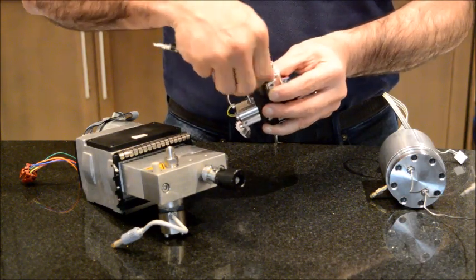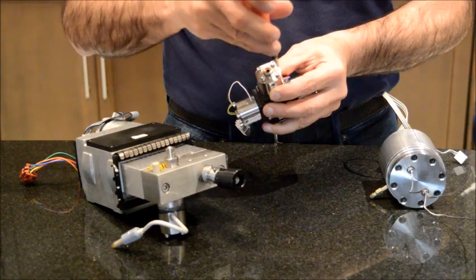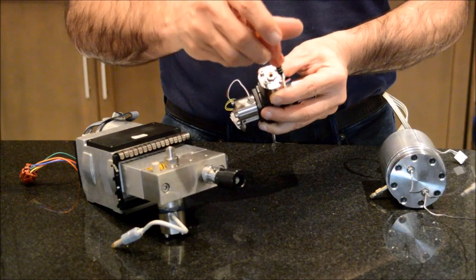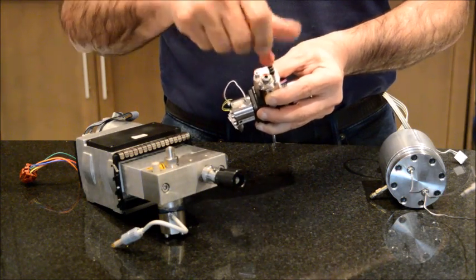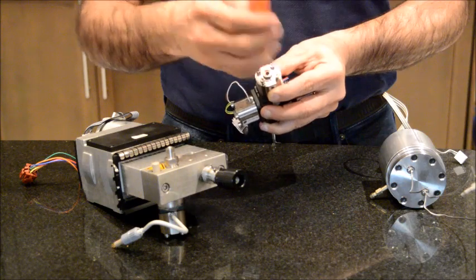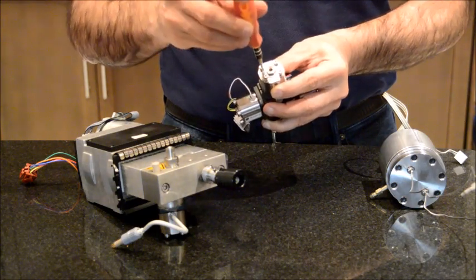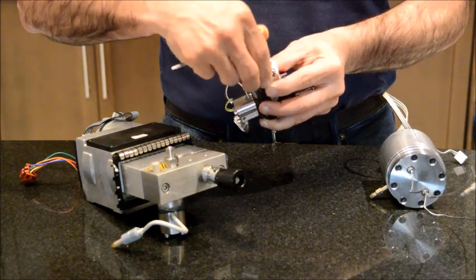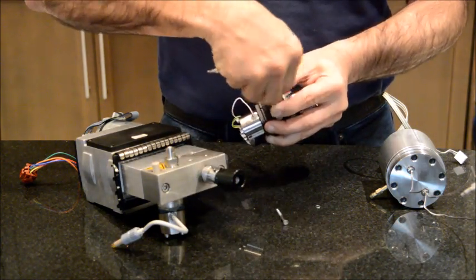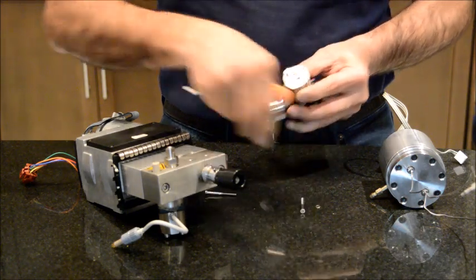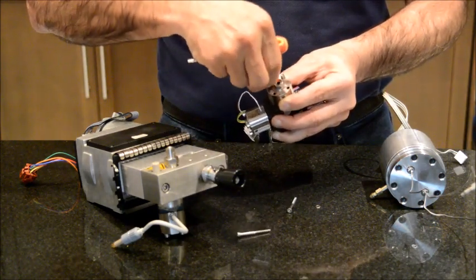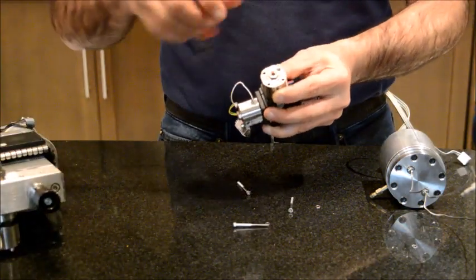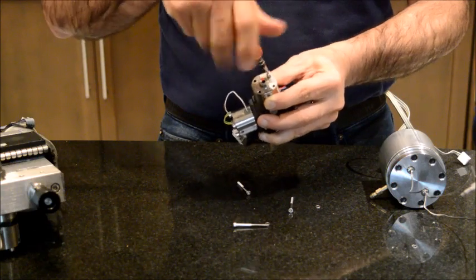I'm holding onto it because there's a spring. If you don't hold it, it will jump and you're going to have pieces flying all over the place. Okay, I have the first screw removed, two screws, third one. I'm going to push away this pump out of the way, and the fourth one.